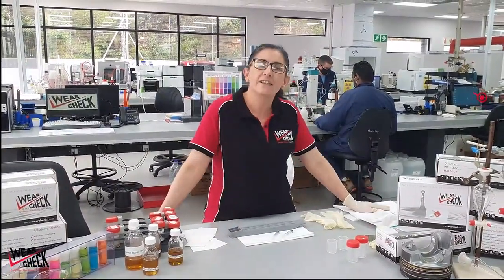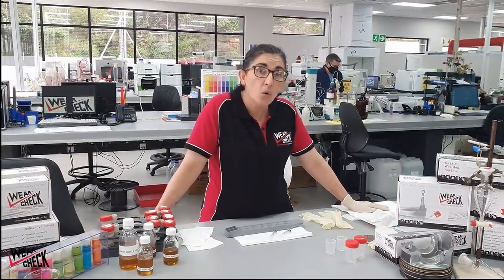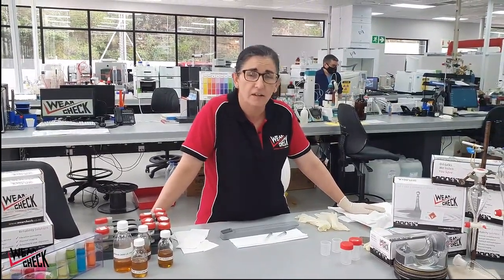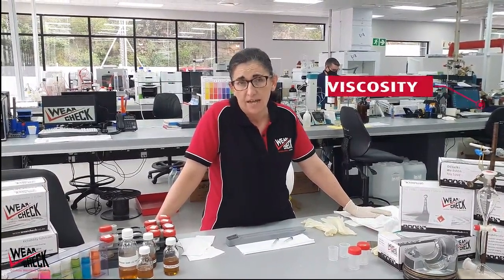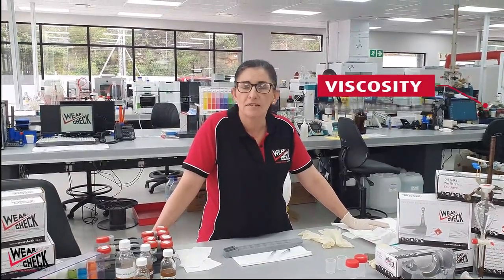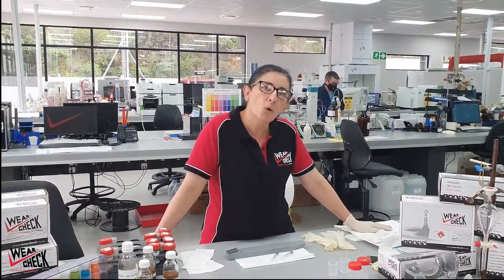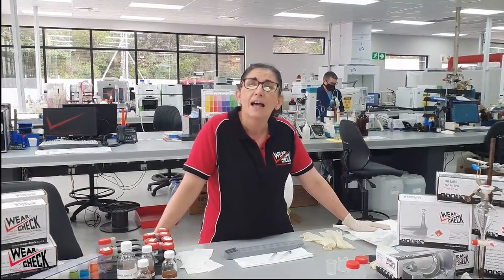The rheostik lends its name from the word rheology, and rheology is a branch of physics that deals with the study of the deformation and more specifically the flow of different materials like lubricating oils. The most important rheological property of a lubricating oil is its viscosity, and viscosity is defined as a fluid's resistance to flow — or in layman's terms, how thick or how thin the oil actually is — and is a reading of great importance because it ultimately affects aspects of tribological behavior like friction and wear of interacting metal surfaces.